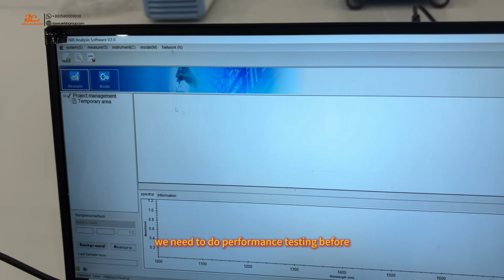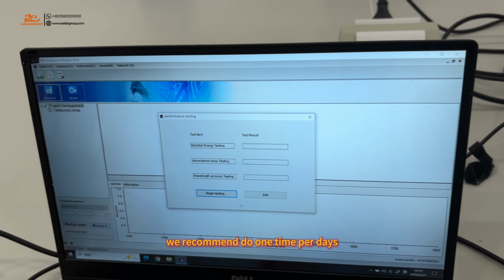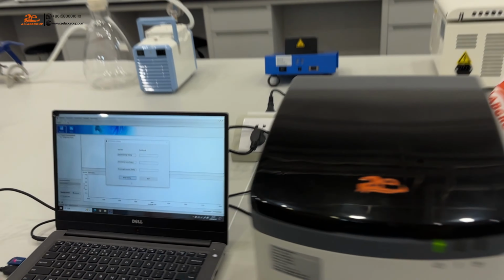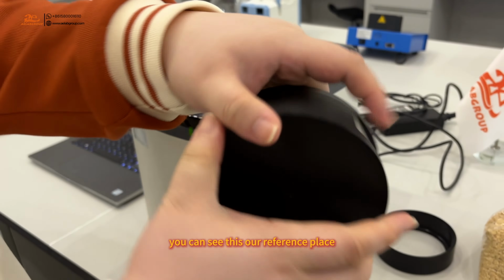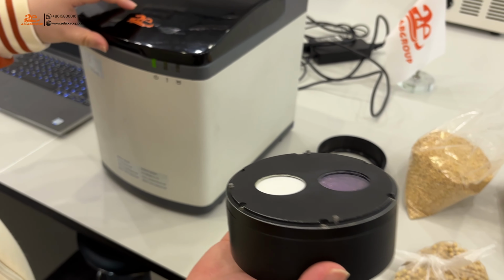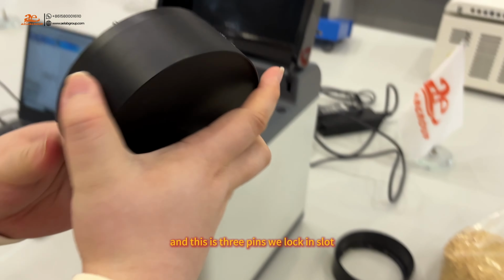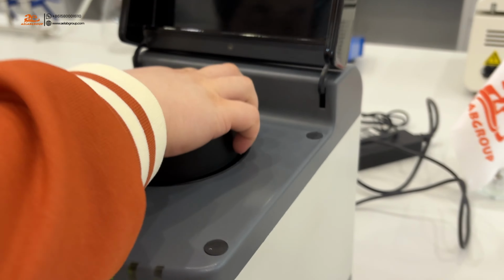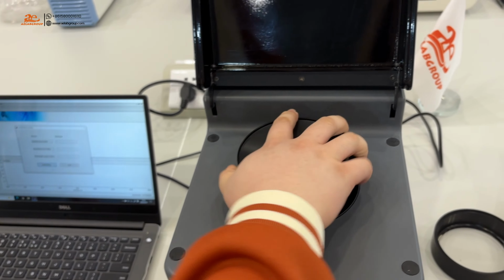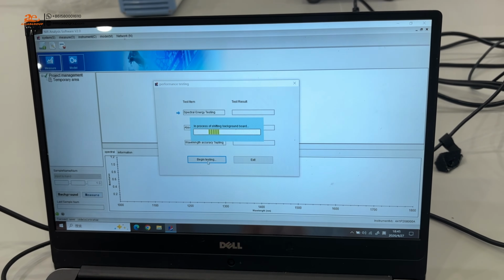We need to do performance testing before. We recommend doing it 1 time per day. You can see this is our reference plate, and this is 3 pins. We lock it in the slot like this, and we press begin testing.